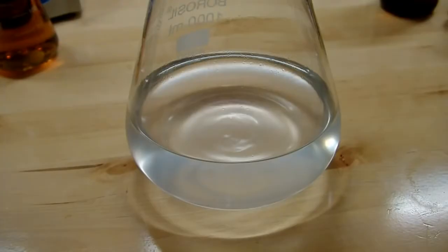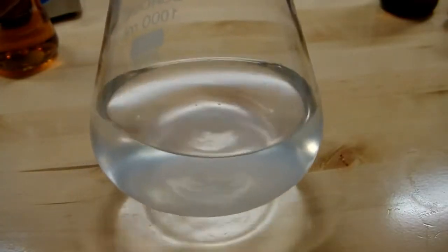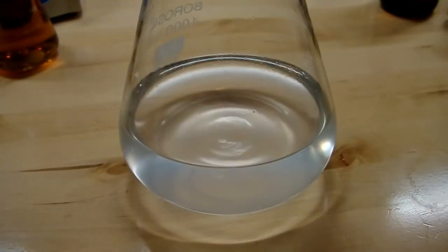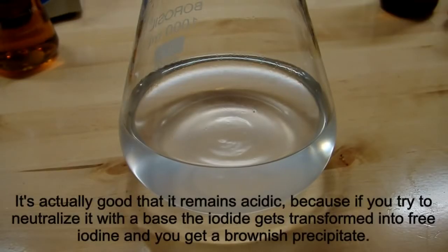Okay, the solution has been completely neutralized now, and it's back to its clear, slightly cloudy color due to the dissolved starch. So this solution now has no iodine in it. It's all been reduced to iodide and is safe to pour down the drain. It's a little bit acidic due to the acids that I used, but all the rest of the components in here are pretty innocuous, and you should just be able to dispose of it with plenty of water.